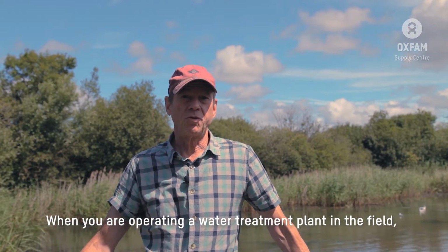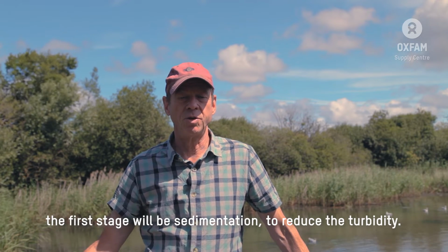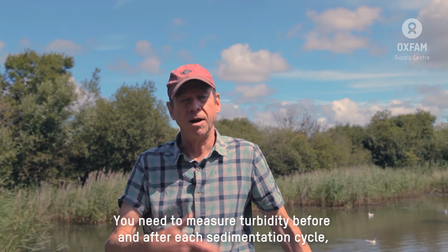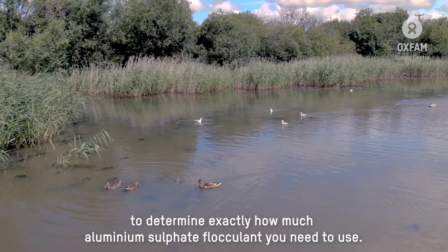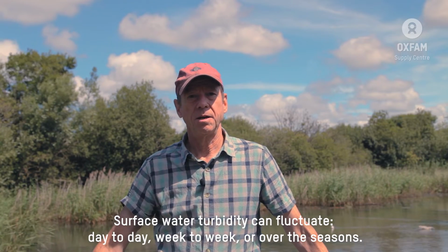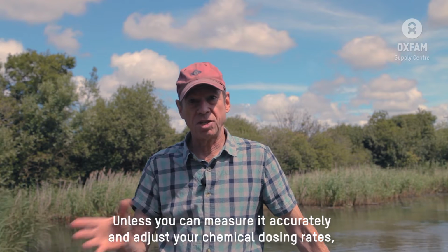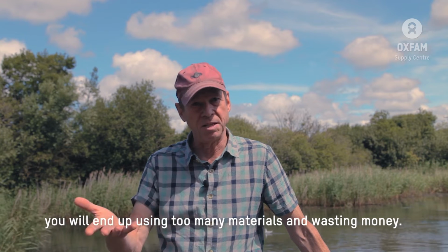When you operate a water treatment plant in the field, your first stage is going to be sedimentation to reduce the turbidity. You need to be measuring turbidity before and after each cycle of the sedimentation to determine exactly how much flocculant or aluminium sulfate you're going to use. Surface water turbidity can fluctuate day to day, week to week, or over the seasons. So unless you can measure it accurately and adjust your chemical dosing rates, you can end up using too many materials and wasting money.